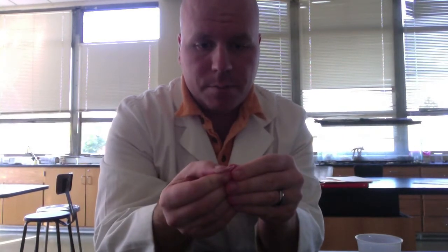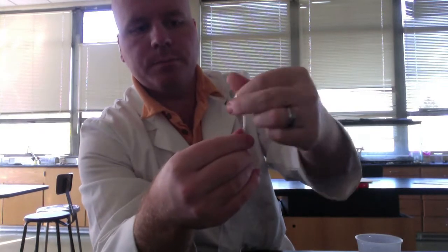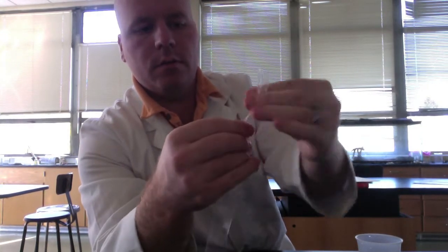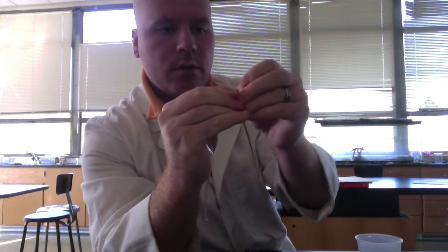All right, so we need to open it. What I like to do is take the top half, or any half, fold it, and rub it between your fingers, like that, and that will allow it to open. So now I have an open side. I got it going a little bit, and I'm going to tie it just like a water balloon. So I'm going to twist it, make a little loop like so, and force the open end through that. Now I have a knot at one end, so it's closed.